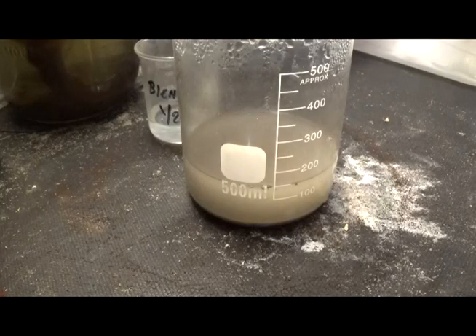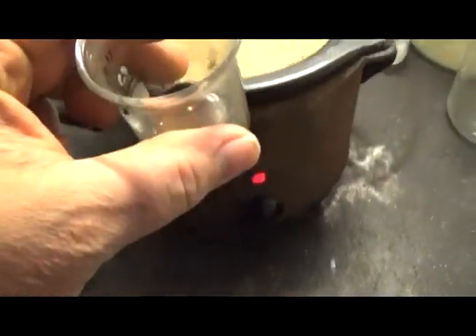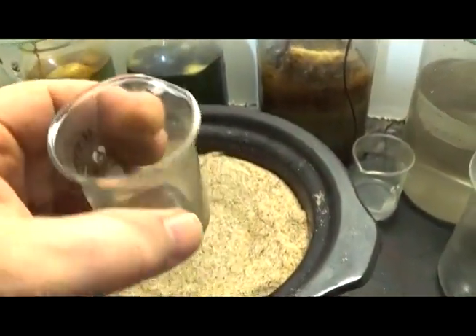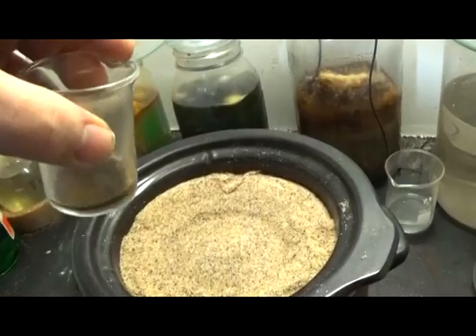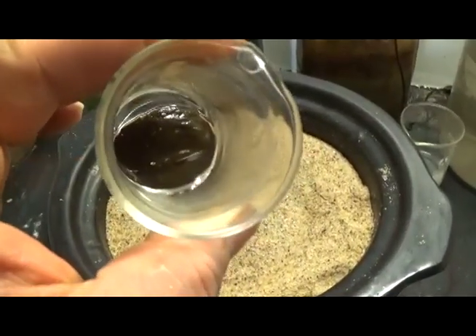Good drop. I didn't have to wait long. I didn't even have to leave the room. So that looks excellent, actually. All right, that's what we got. There's not too much light here. After all that, and you see some sparkly gold bits in there.